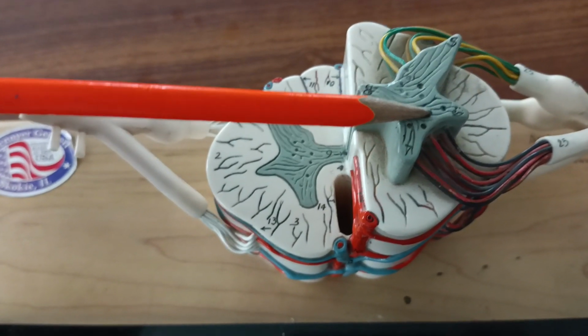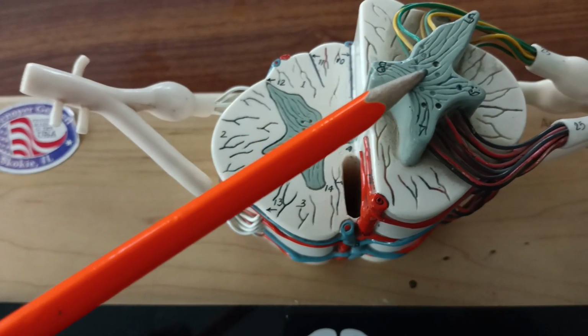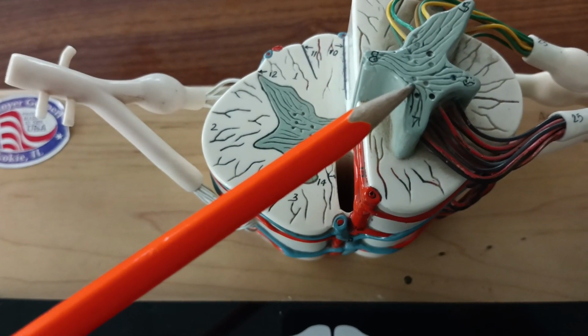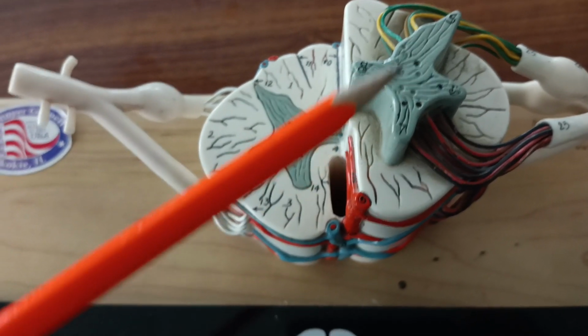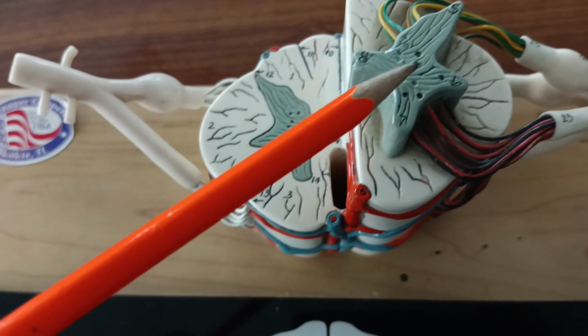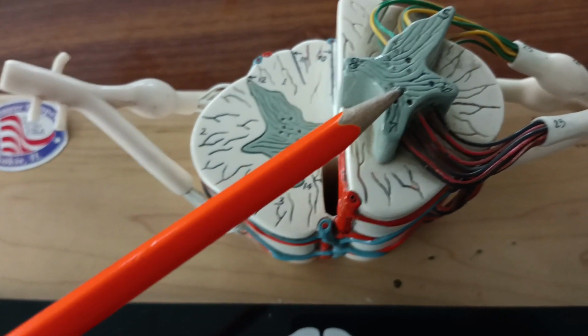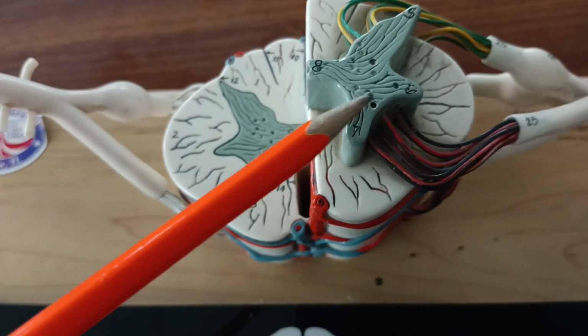the sympathetic portion. Now you can observe that this gray matter is filled with neurons and a few initial segments of unmyelinated axons. They could be supporting cells or neuroglial cells as well. The neurons have a prominent nucleus and nucleolus and are laden with Nissl substance.